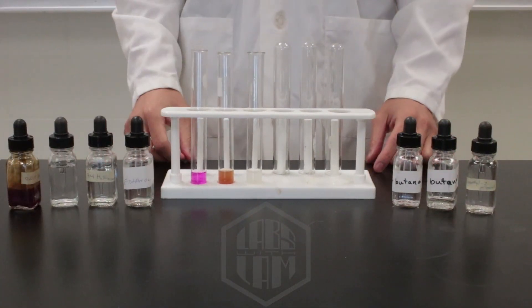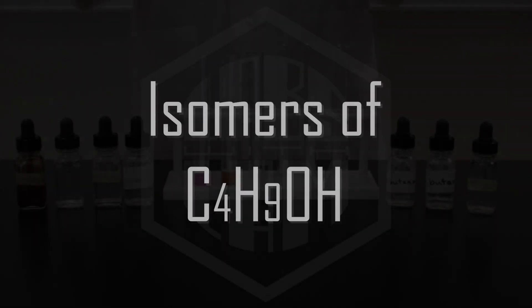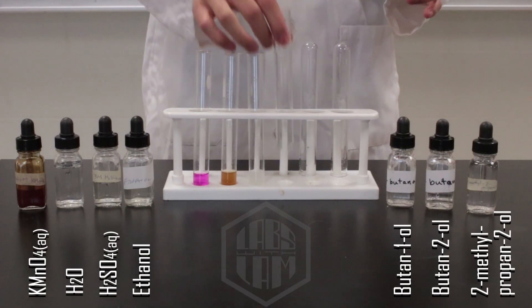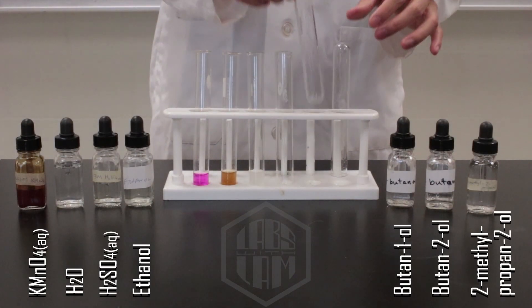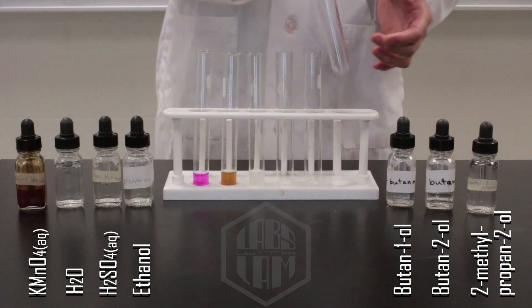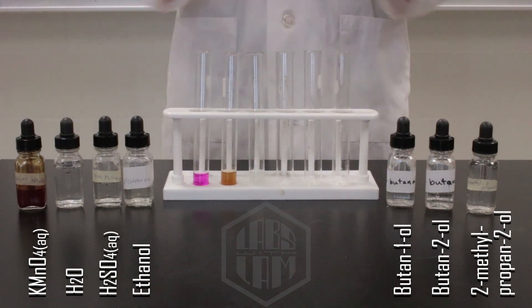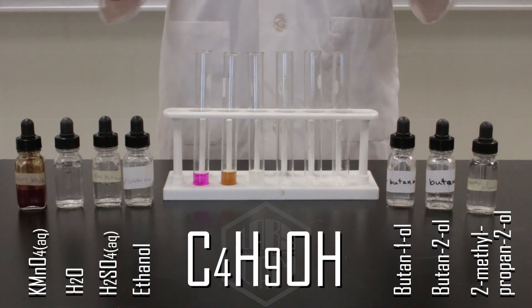And now on to part two. For part two, we're essentially doing the same thing we did in test tube three, but using three different isomers of C4H9OH.